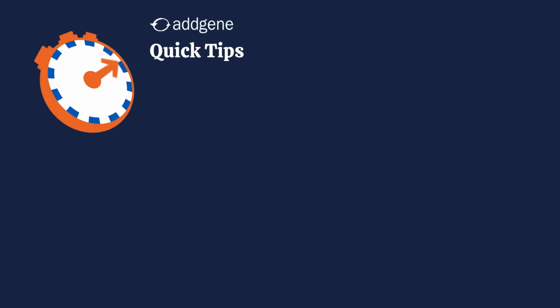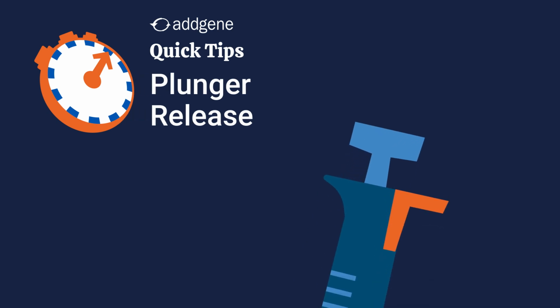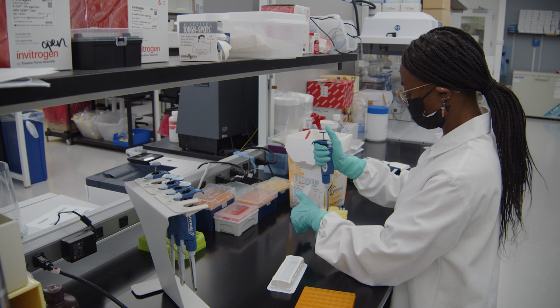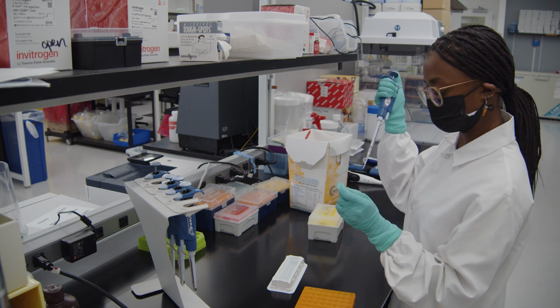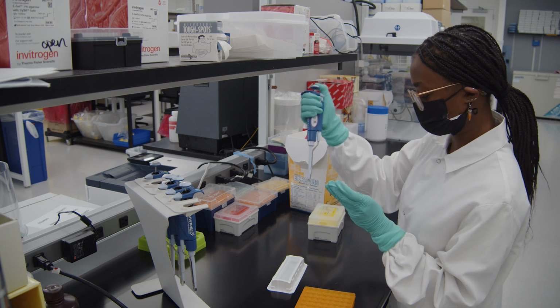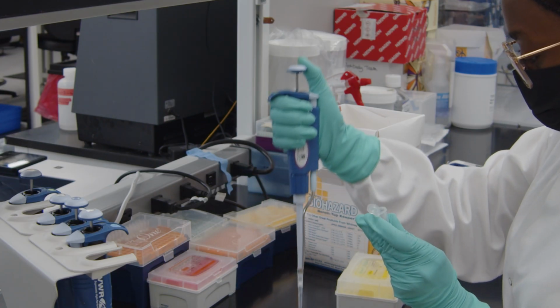Welcome to Addgene's Quick Tips, where we like to take it slow and steady, at least when we're talking about releasing a pipette plunger. As you repeatedly pipette, you may find yourself speeding up. While this isn't in itself bad, your plunger release technique could be suffering. So slow down for a minute.